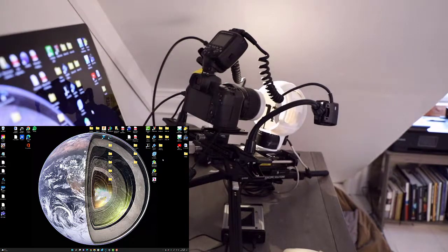And the specimen also has two challenges associated with it. One is it's very dark in color, almost black. And the second is that there are characteristics on this specimen, such as the hind legs and so forth, that are incredibly shiny. So we're going to have some trouble trying to get rid of glare on an image like this one. So now what I'd like to do is walk you through how to do that, or at least mitigate that when capturing images.